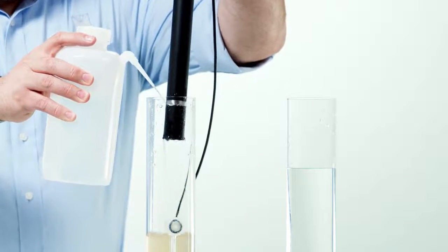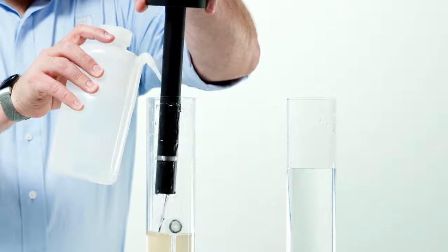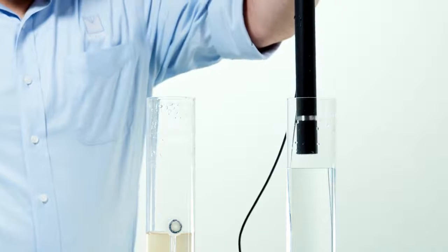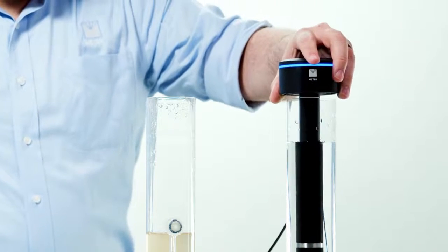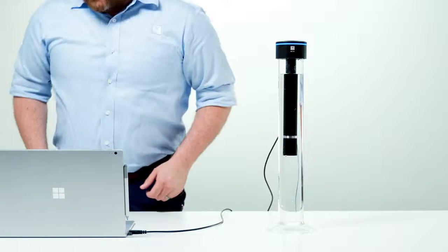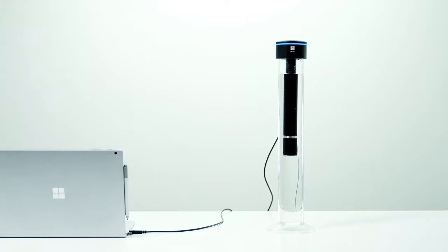Note that since the PARIO device transfers a small amount of the suspension from the sedimentation cylinder to the standby cylinder, the distilled water may change over time and algae may form. If this happens, replace the distilled water. The PARIO devices in standby position are instantly ready for the next measurement. For short-term storage, for example when the next measurement takes place immediately afterwards or within a few days, the device can be kept permanently in the standby position. For information on long-term storage, see the user manual.